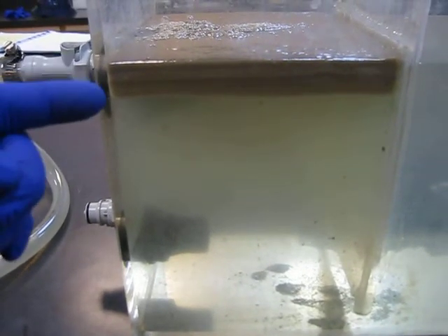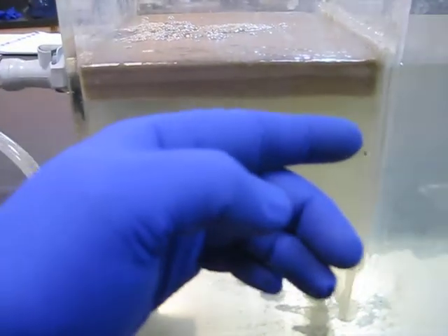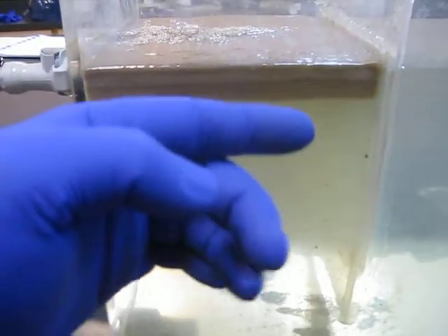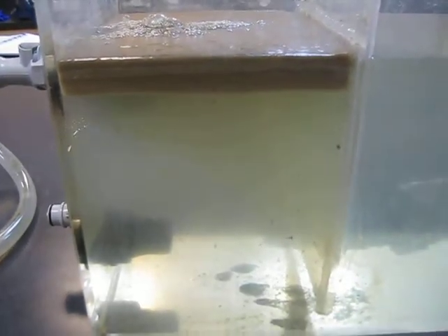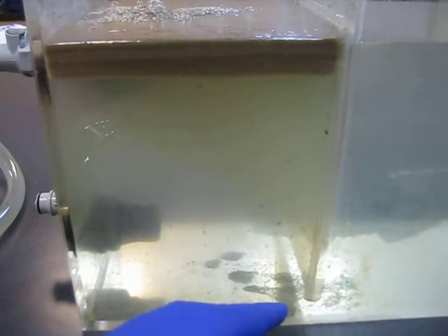The water comes in through the top section, and it hits that wall, and then we get gravity separation of the solids to the top. And clean water flows out under the bottom of the weir into the second section.